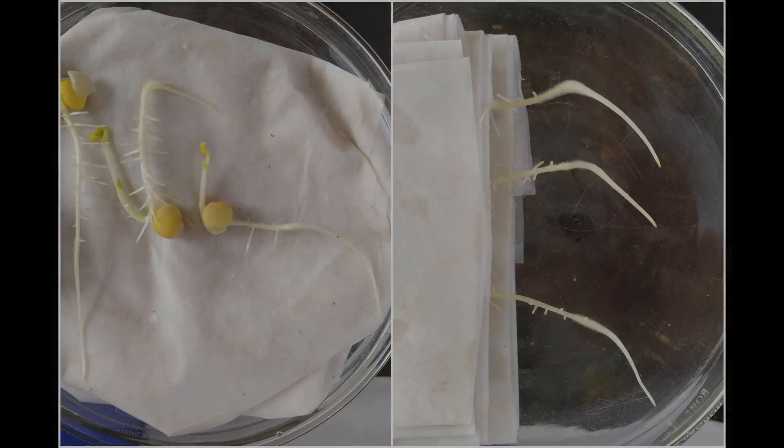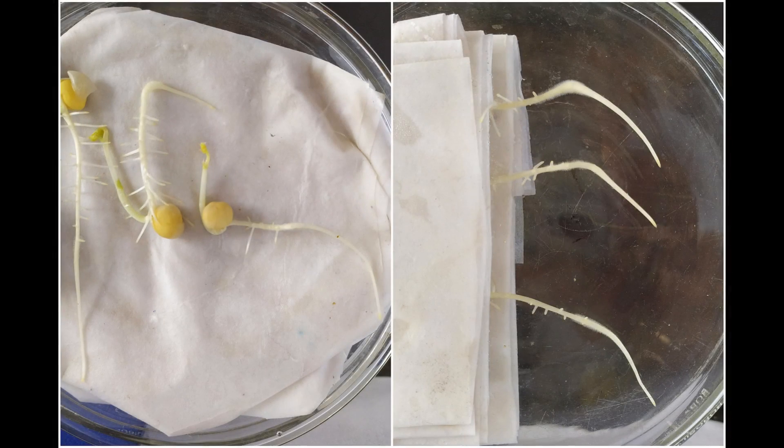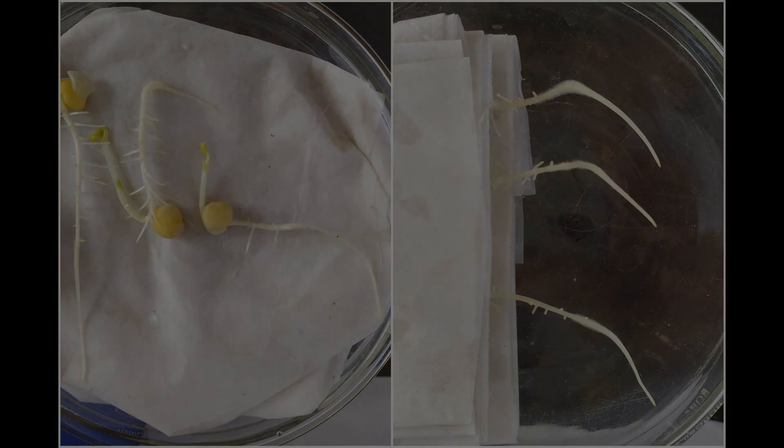This simple experiment clearly shows the positively geotropic nature of growing roots while also showing negative geotropism in the growing shoots.